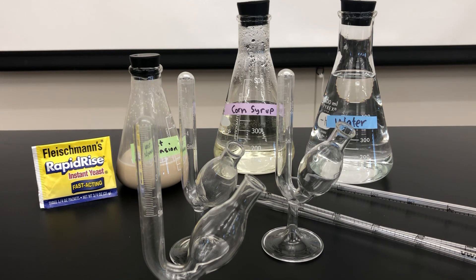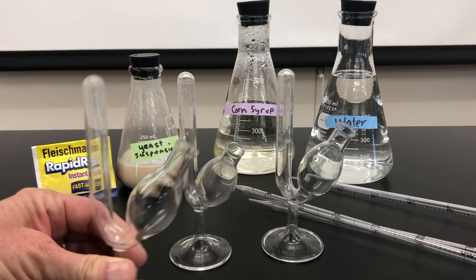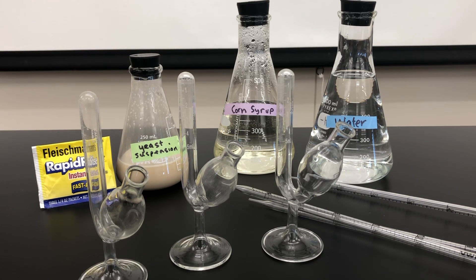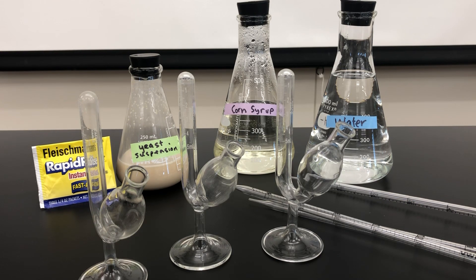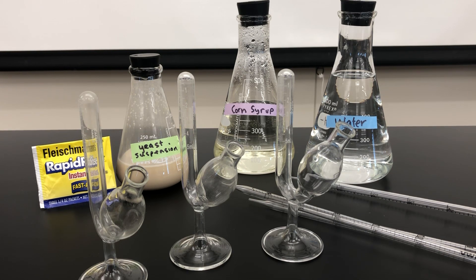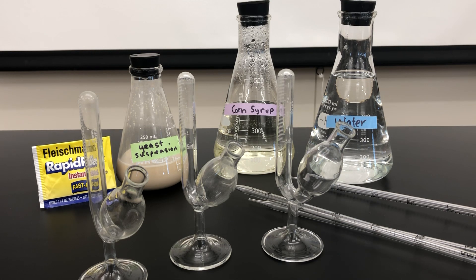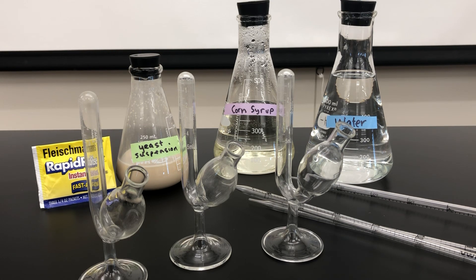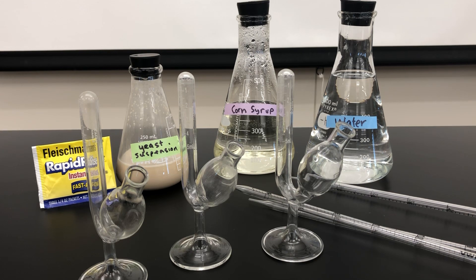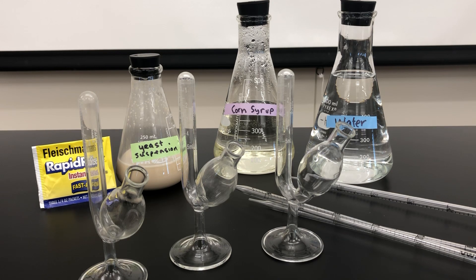Following table 5.1, we'll fill each of these fermentation tubes with water, yeast, and corn syrup. Notice the corn syrup is exactly the same in all three, and corn syrup is our sugar source. What we are varying are the amount of water and yeast.